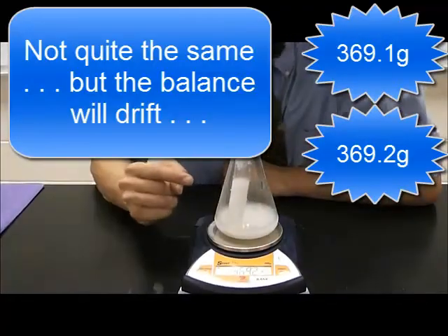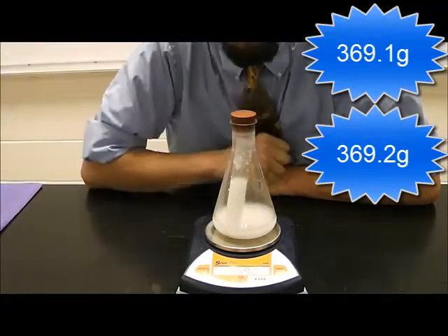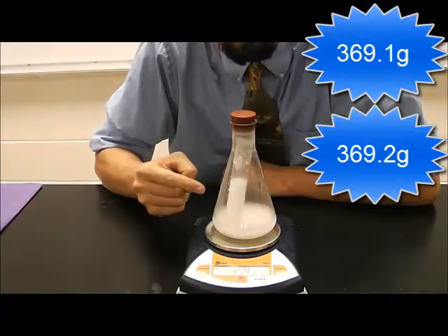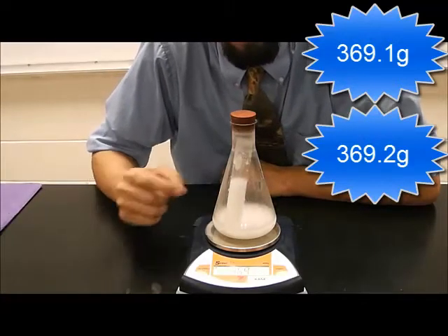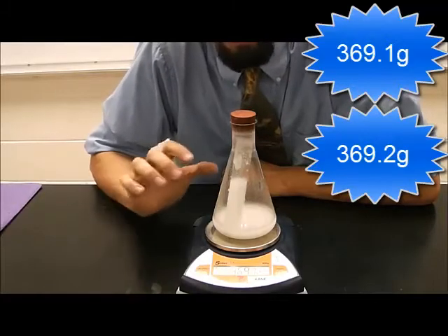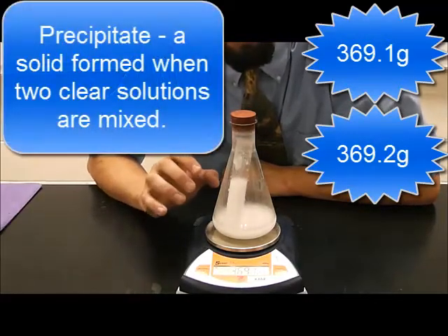Now, the way that I know a chemical reaction happened here is because of two things. Number one, I have a color change. It went from a clear solution to a white solution. The other thing that's telling me, it's cloudy. So I now have a precipitate that has formed.